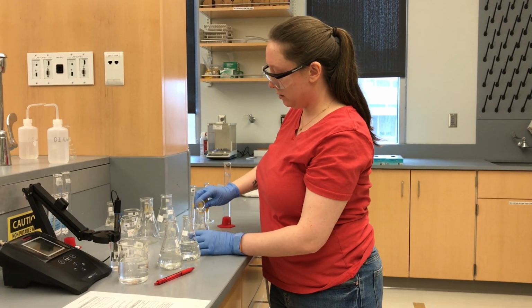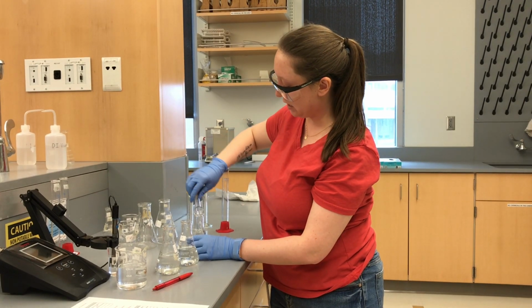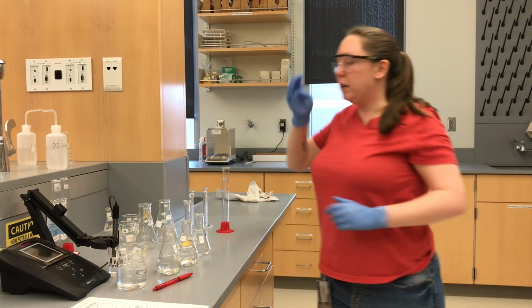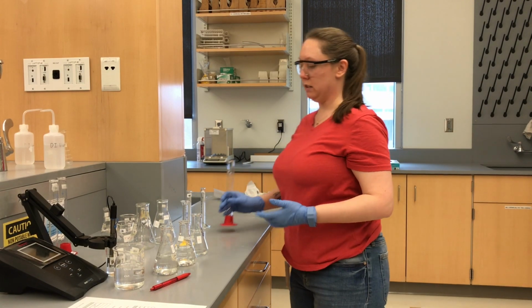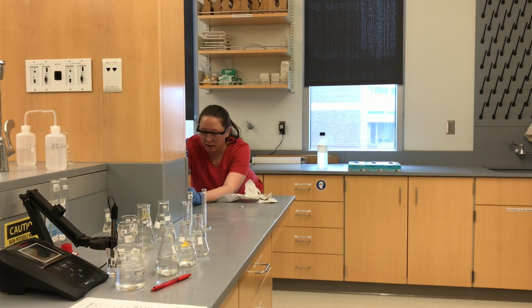Now would be a good time, as you saw me struggle to get 10 mils exactly. What would be a better way to transfer more exact volumes? So think about that.